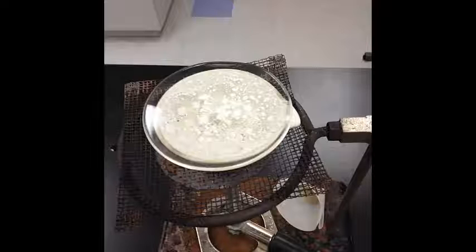Once that's reached, it's completely dry, we will then be able to determine the mass of the salt. From the mass of the salt and the mass of the sand, you can determine the percent salt and percent sand, and from the initial mass and the sum of the masses of the recovered substances, you can determine your percent recovery. Remember to record the data on the data table in your lab logbook. Remember to show all of your work for your analysis, and as you write your conclusions, remember to record those also in your lab logbook.